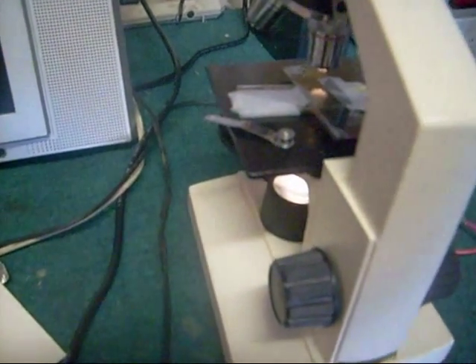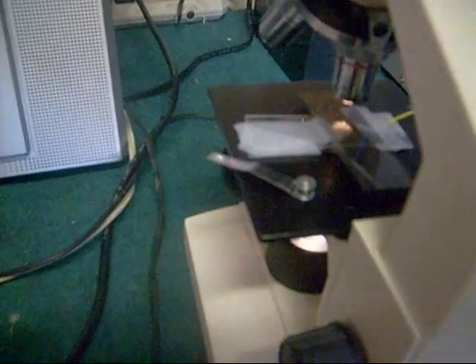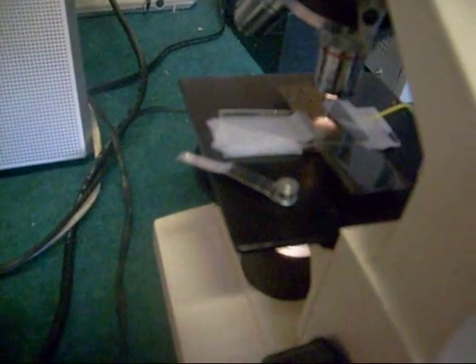OK, time for a new experiment. This time I took some of the liquid crystal, put it on a slide, but I put two polarizing filters on the outside of the slide, and we'll put it on the microscope and see what happens.